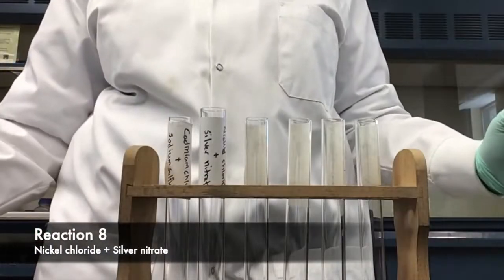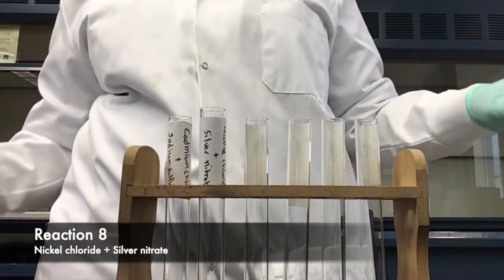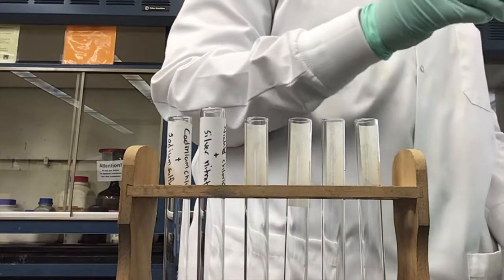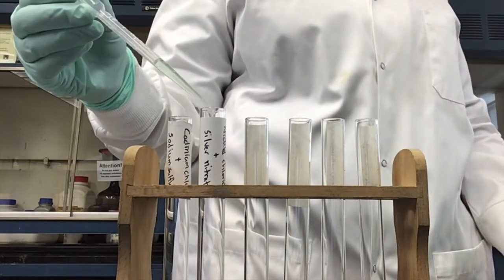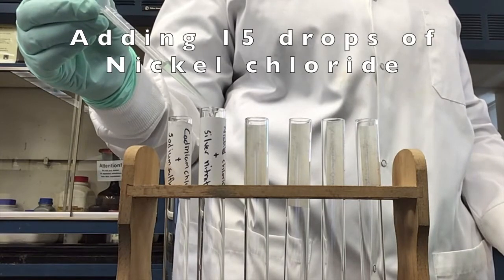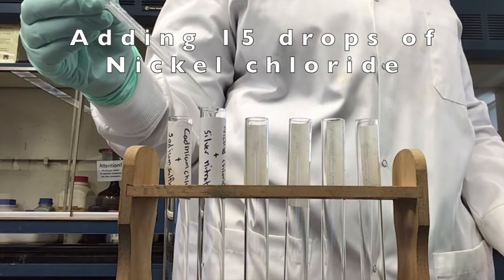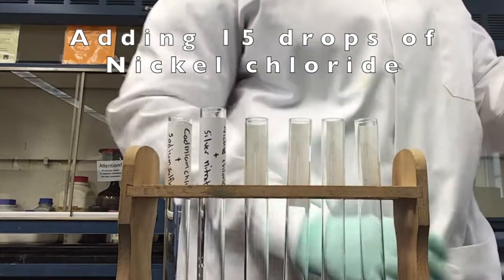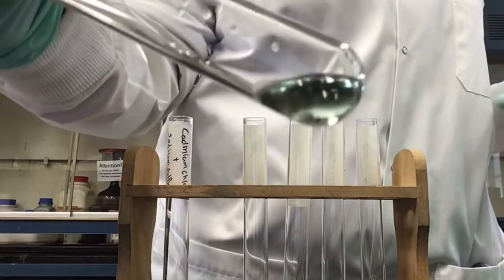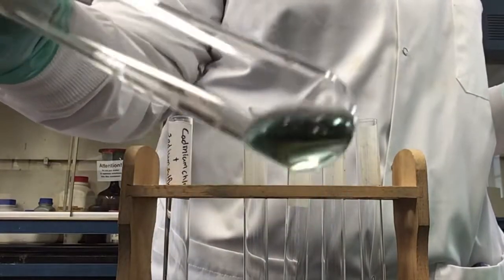Next we have reaction 8, which is nickel chloride and silver nitrate. We'll start off by adding 15 drops of nickel chloride to our 8th test tube. Note the emerald green color of nickel chloride in the test tube.